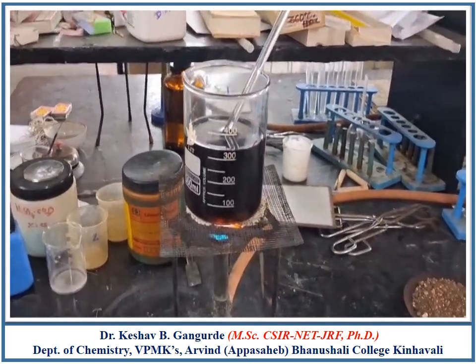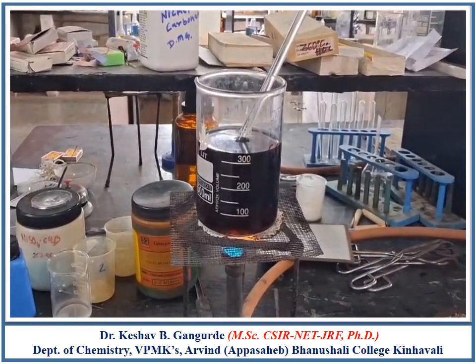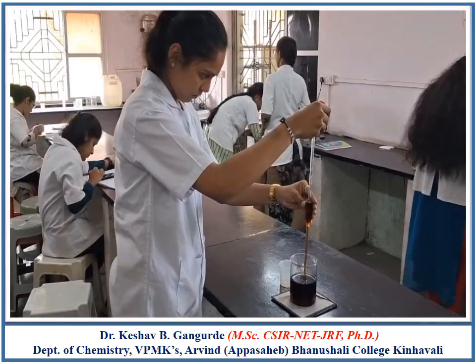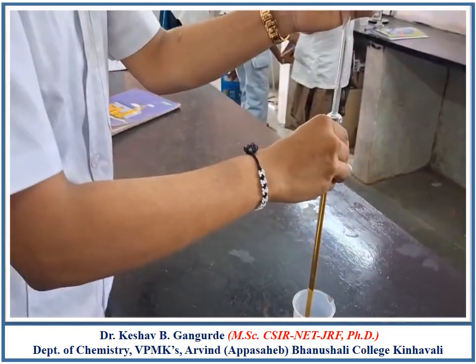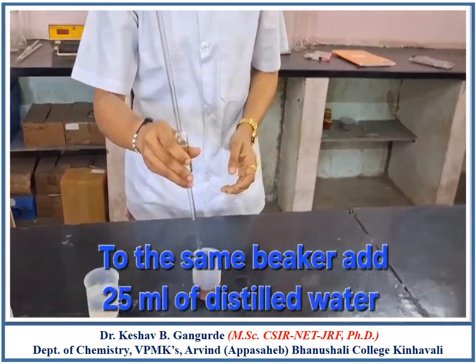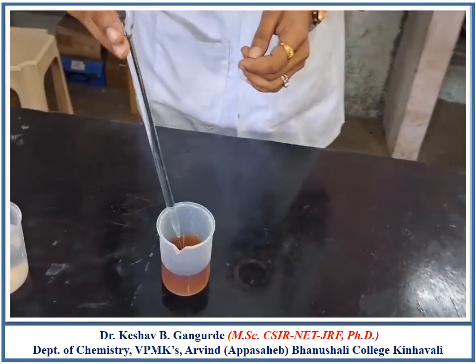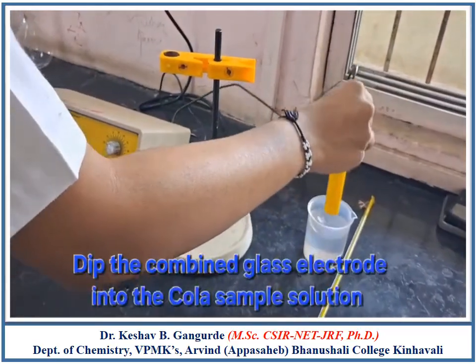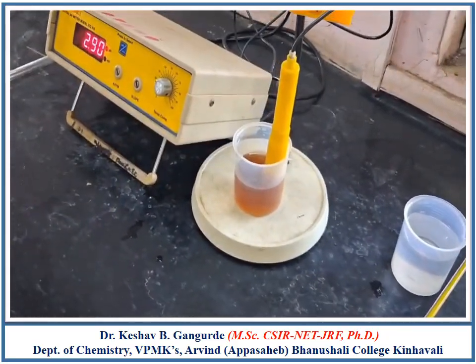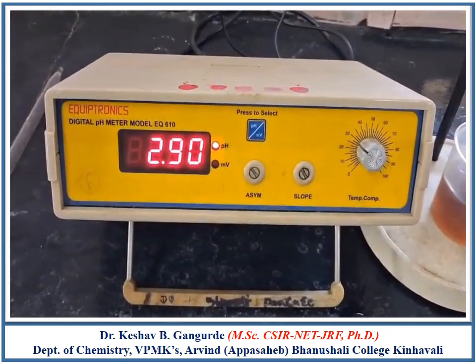In the estimation part, first heat the Coca Cola sample to let the dissolved carbon dioxide escape. Pipette out 25 ml of Coca Cola sample in a 100 ml beaker. To the same beaker, add 25 ml of distilled water. Insert the combined glass electrode into the cola sample solution and measure the pH reading on the pH meter.